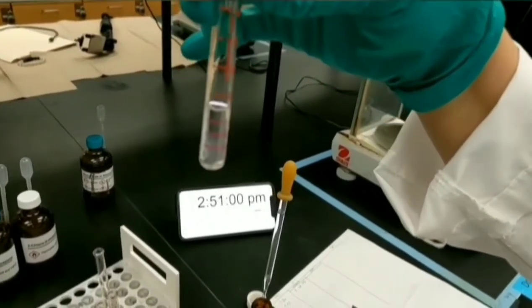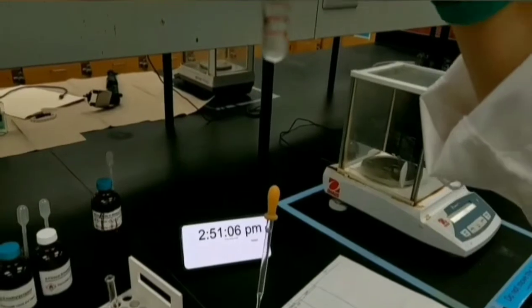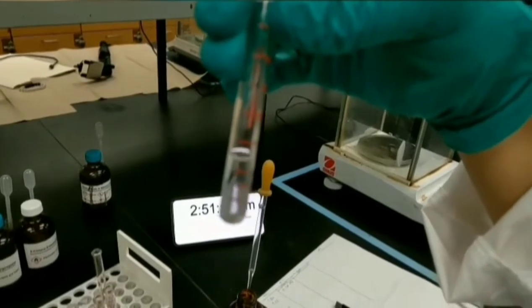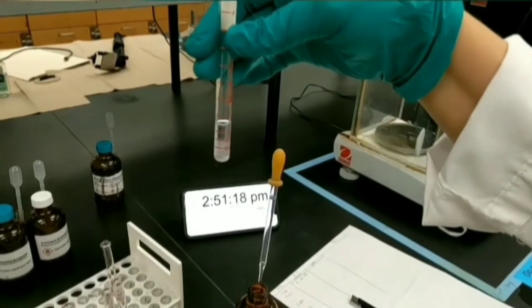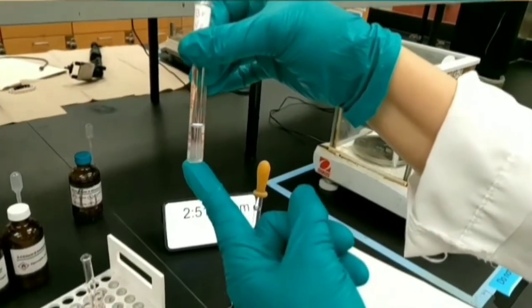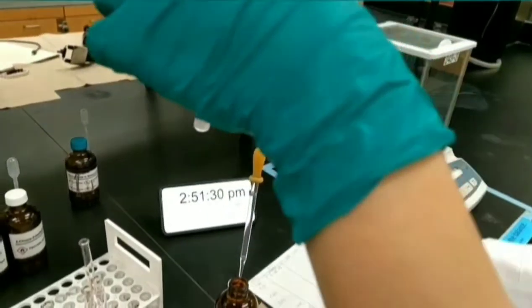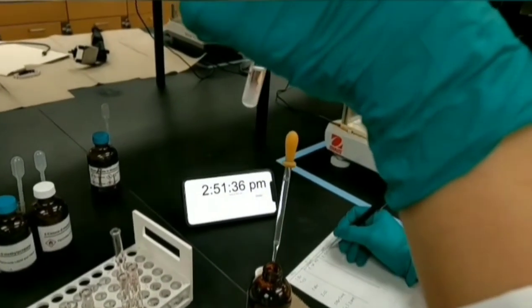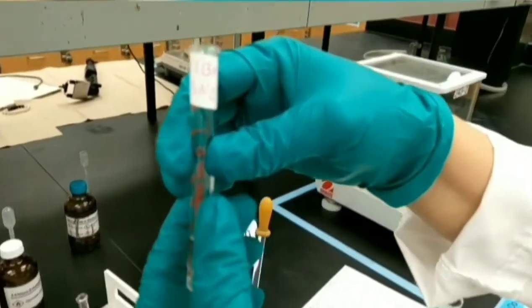As you can see, it starts to make a cloudy solution, so you need to record the time for the end of the reaction. This is a primary alkyl halide, and what we expect from it is reacting fast and quick with a strong nucleophile through an SN2 reaction, because primary alkyl halides have low steric hindrance. Because of that, they are so proper for doing SN2 reaction.